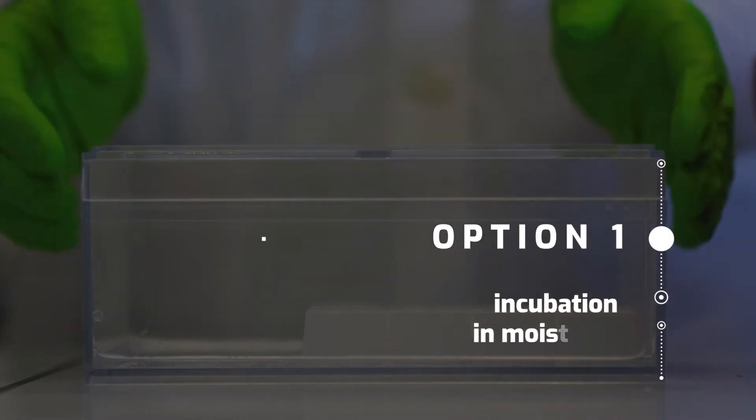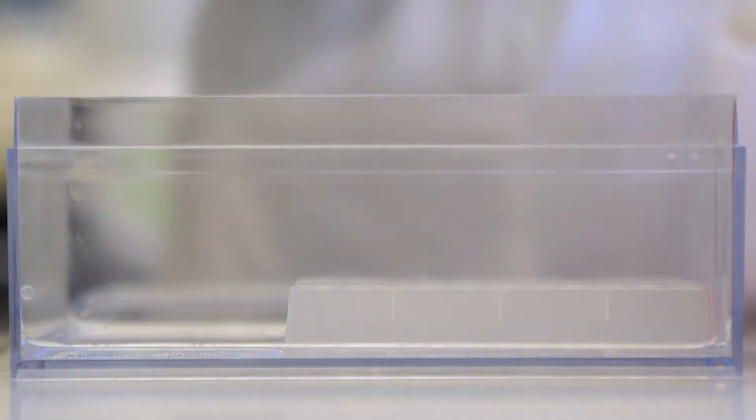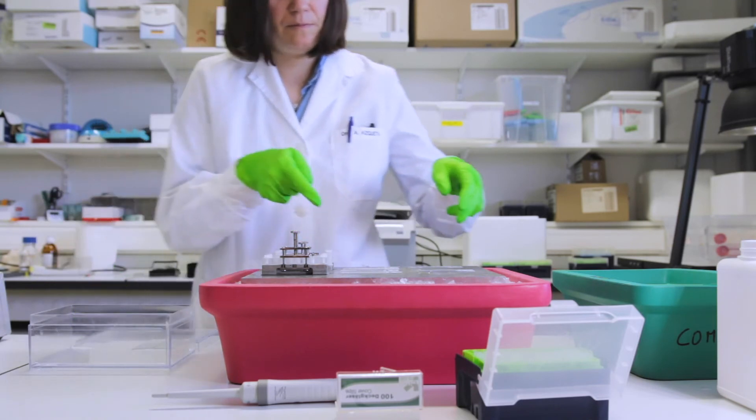Okay, so for the incubation we will show you two things. First with a moist box. So you will see that in the bottom there is a layer of water and a holder to put slides. You can put your slides there with the cover slip.